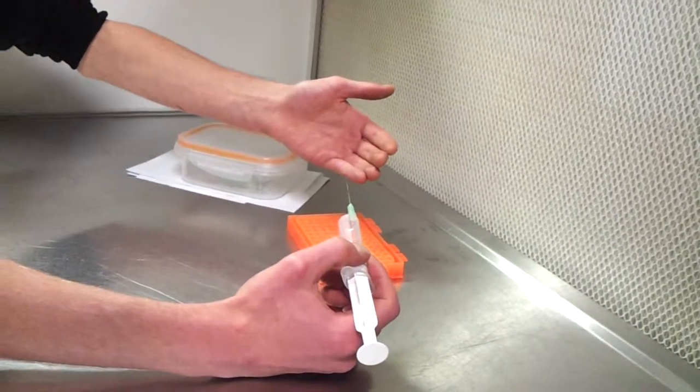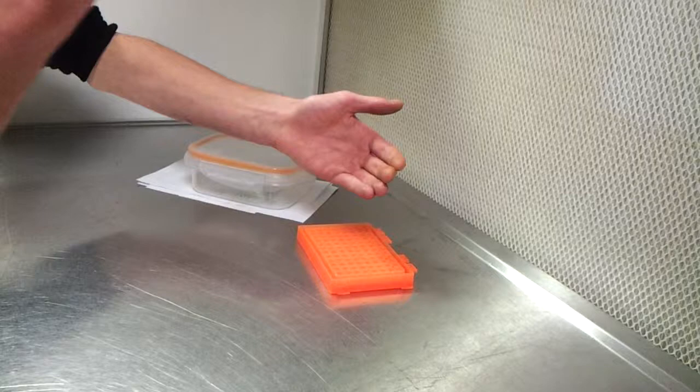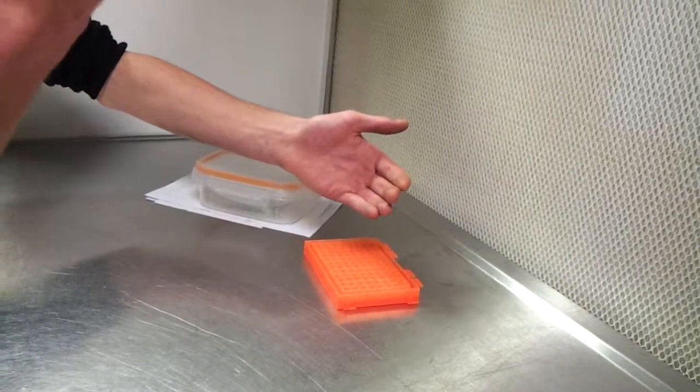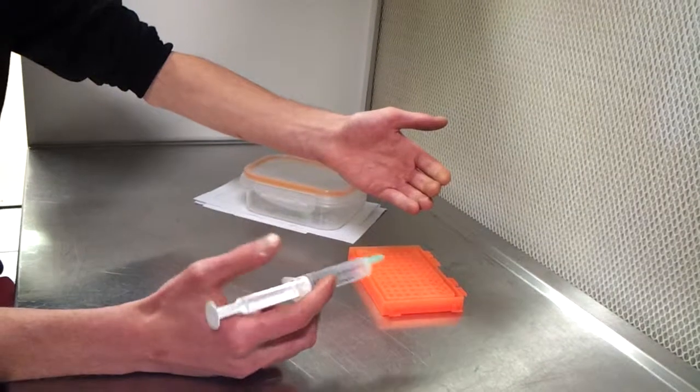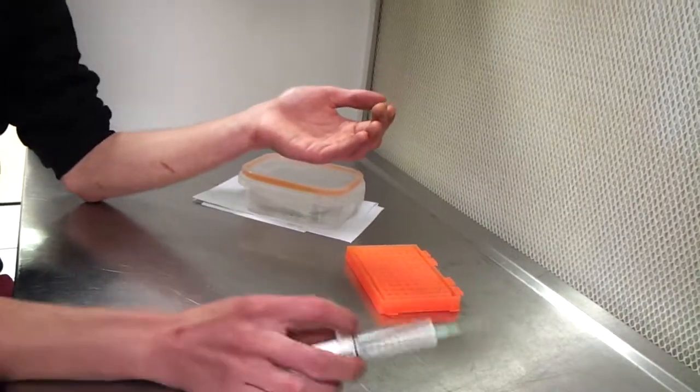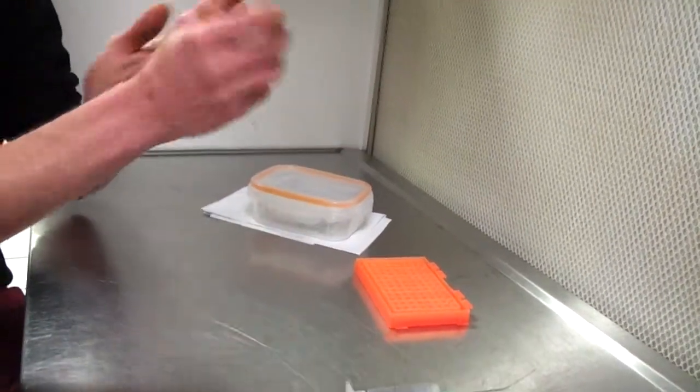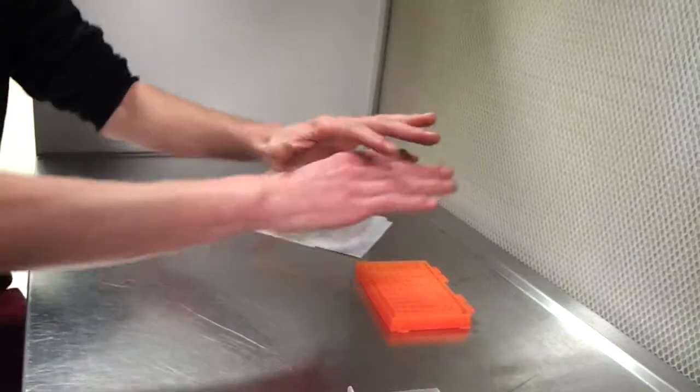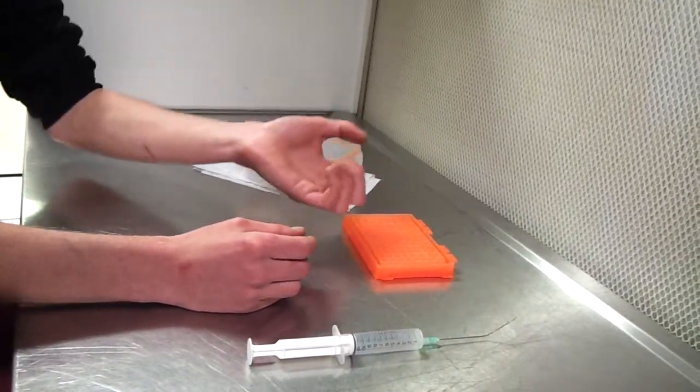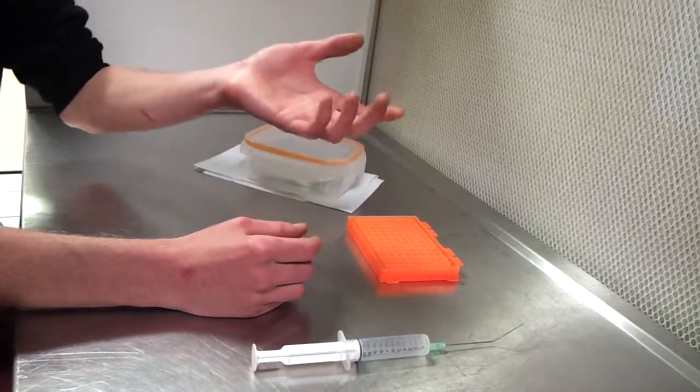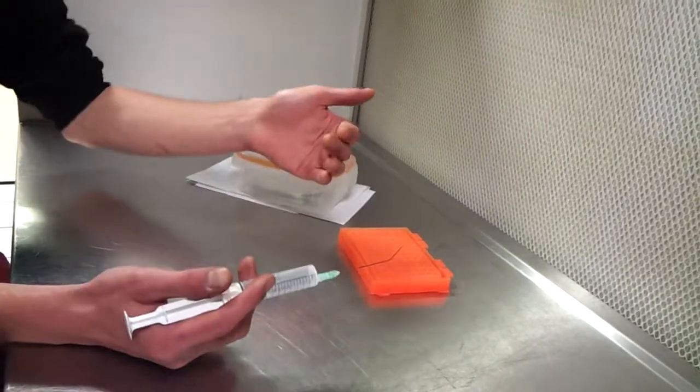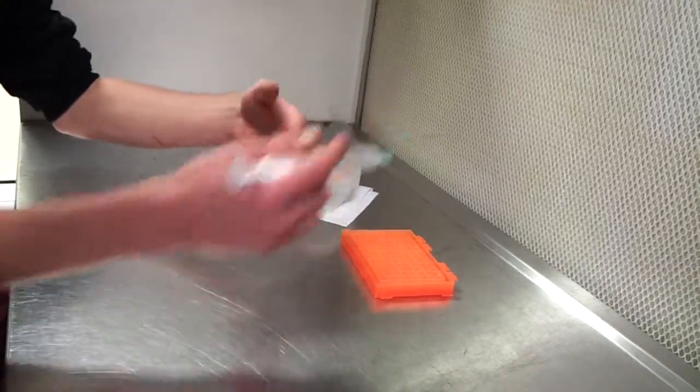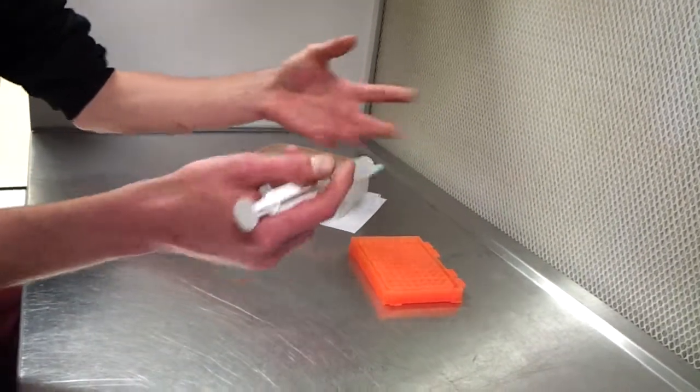With water? Without anything, the water is in this. Does the glass have to be sterilized? Yeah, it has to be sterilized the same way. Not the same way—you can put some alcohol and let it dry near the flame. It's good, you don't have to heat too much the glass because it will kill the spores. But you have to heat enough to kill other bacteria and contamination.